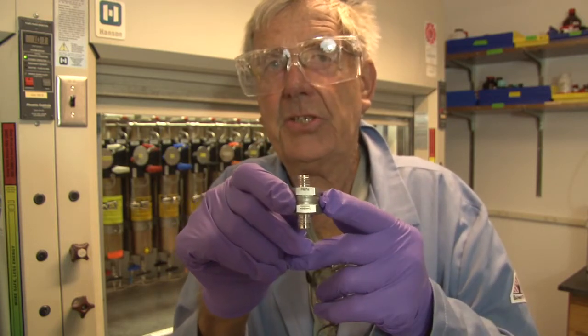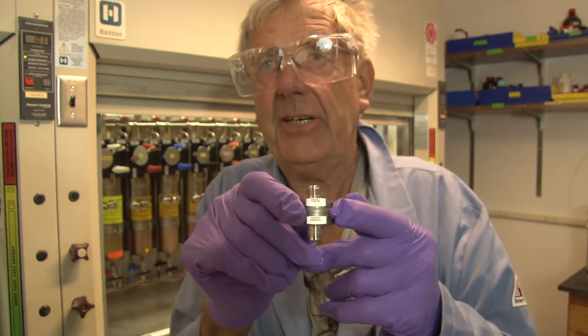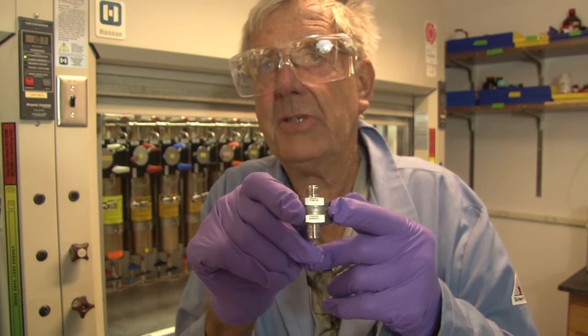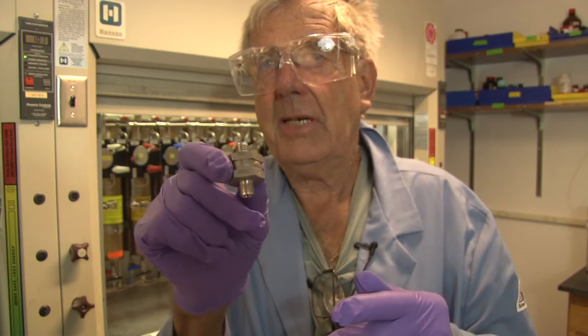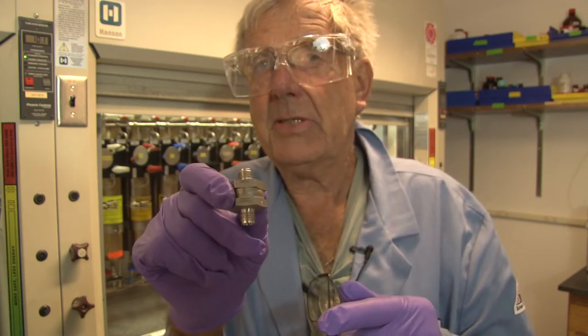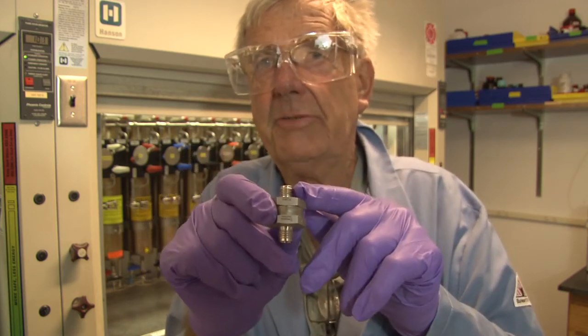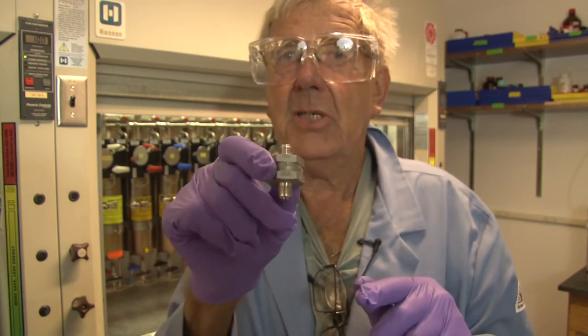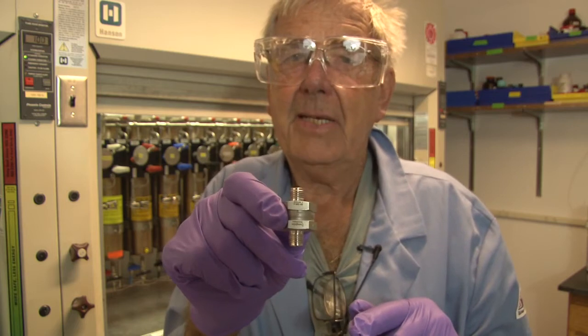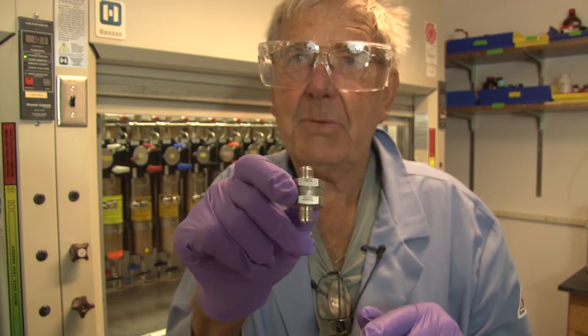So when restarting the system, it will take 5 to 10 minutes to refill the column. And that is mostly the time when you have to clean this filter, because the sub-2-micron particles start to clog the filter. However, if the flow is sufficient, do not clean the filter until it becomes a problem.